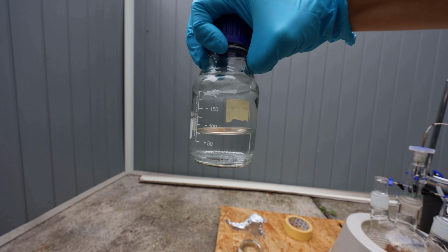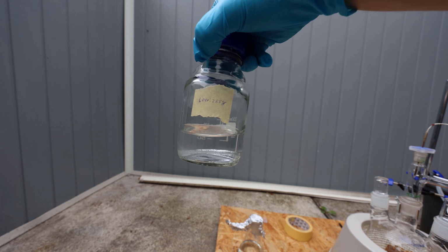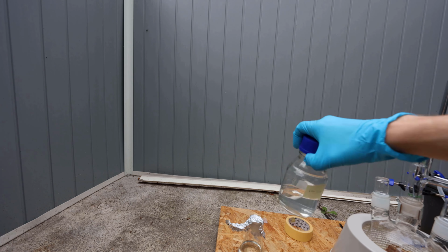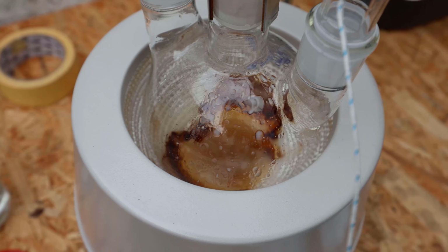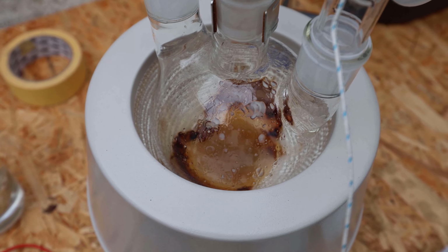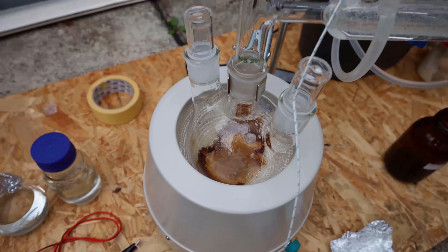Since the distillation was relatively fast, I'm going to use the separatory funnel on this, decant the water layer, put this together with the other stuff, and redistill this again really quickly. Also, this is the boiling flask, and you can see all the crap in there and the yellowness that started to come over and ruin my cyclopentanone.